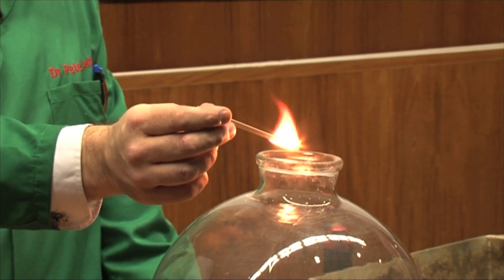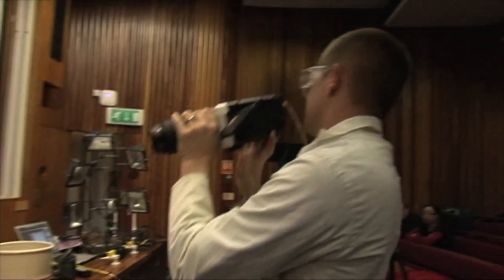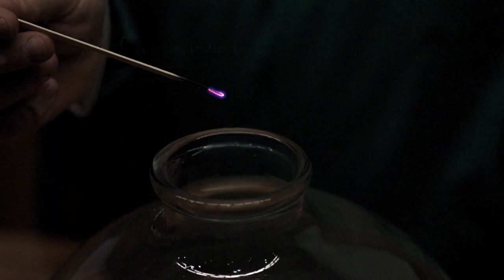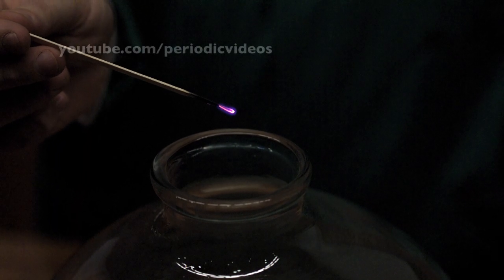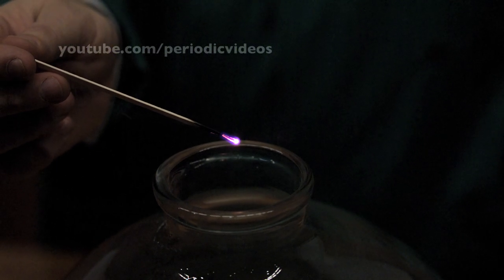And it's to take a glowing splint and pop it into an oxygen-rich atmosphere, because what happens is the oxygen gets to the warm, hot wood, or the carbon, and starts the combustion reaction again.